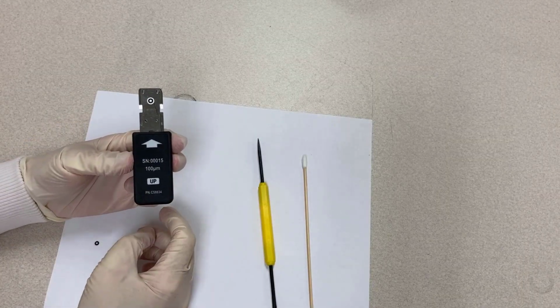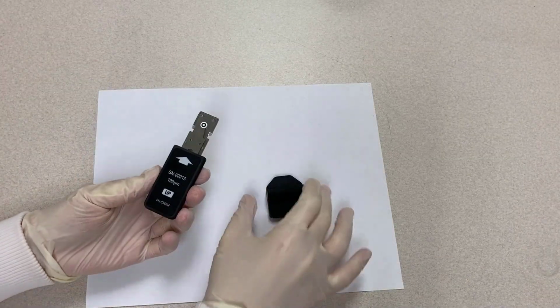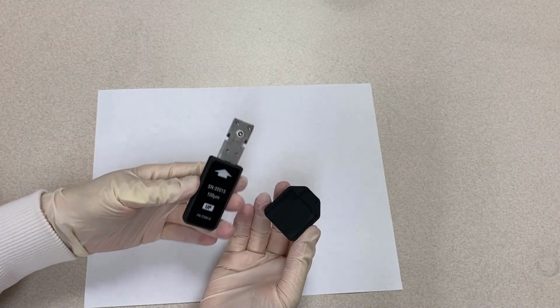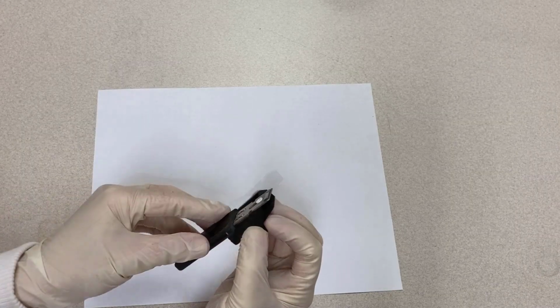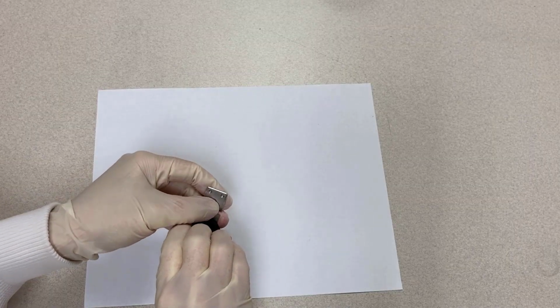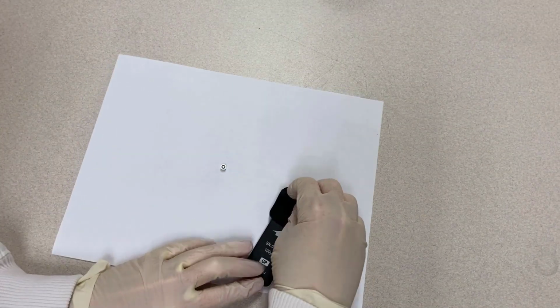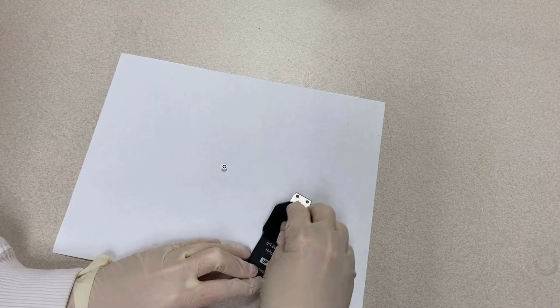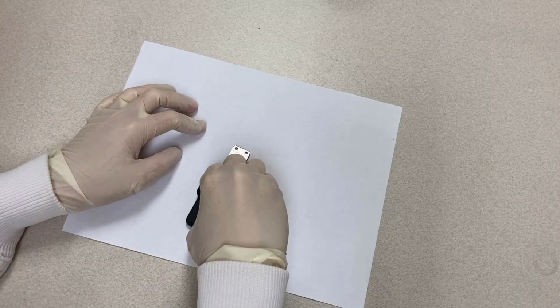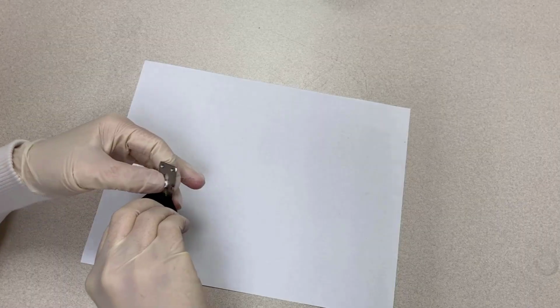Here is the nozzle module. Use the dedicated tool to compress the nozzle spring all the way down to its limit and slide the nozzle out. Insert the nozzle with the O-ring facing up into the slot of the nozzle holder. Slide the nozzle to its end and release the spring slowly.